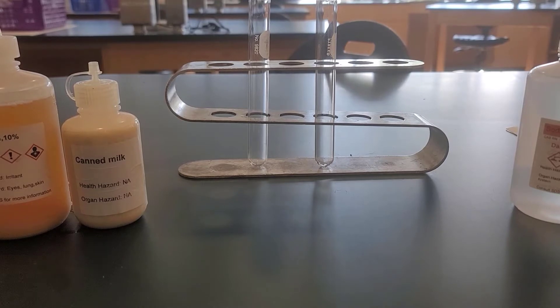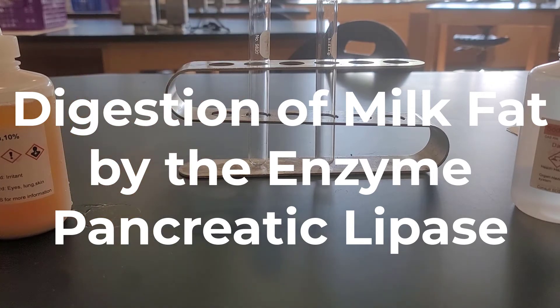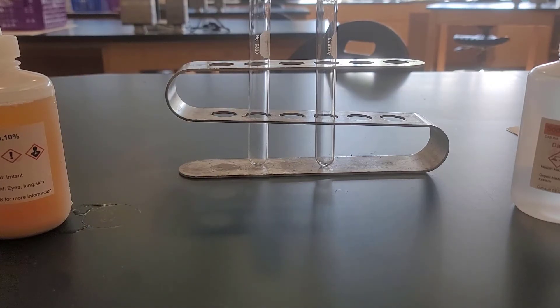Okay, another classic general biology experiment that we do in our lab is the digestion of milk fat using the enzyme pancreatic lipase.